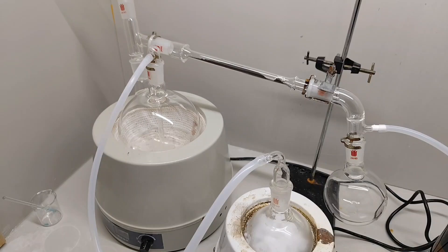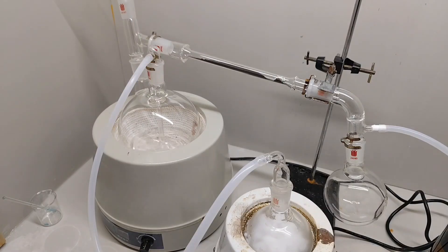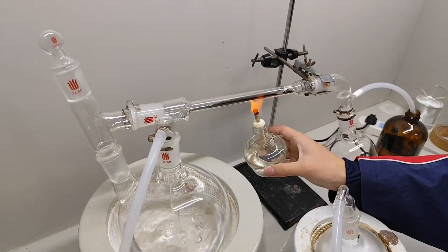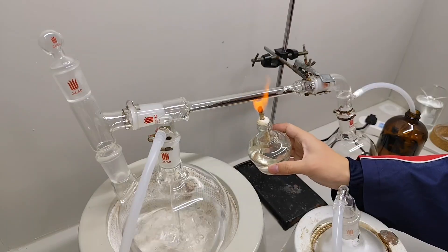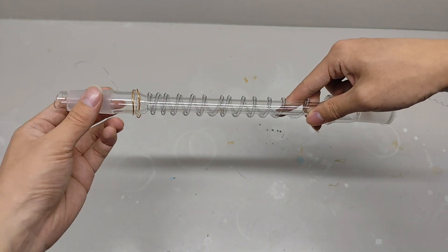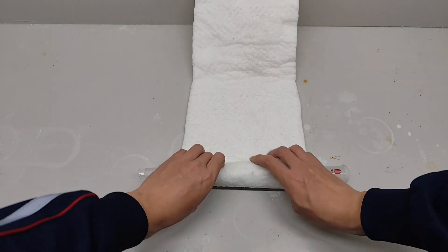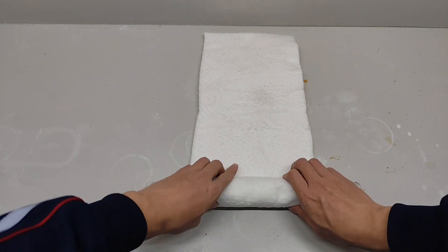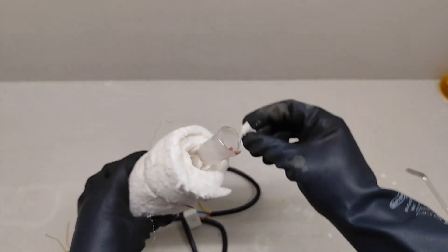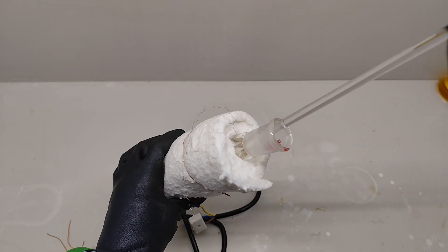The dehydrogenation reaction is endothermic, so it needs to run at a relatively high temperature. At first I used an alcohol burner to heat the glass tube containing the catalyst, but the heating area and power were too small. I then bought a 200W heating wire, wound it around the glass tube, and wrapped it with glass wool. However, the power was too high, so a 50W or even 30W wire is better. To prevent the powder from blowing out, I placed glass wool at both ends of the glass tube with the catalyst in the middle.